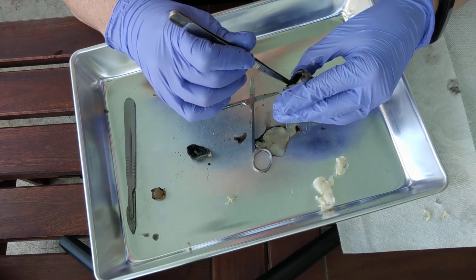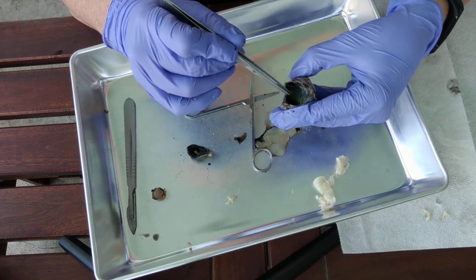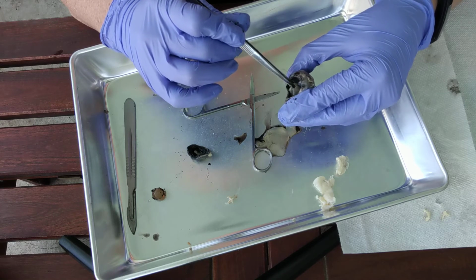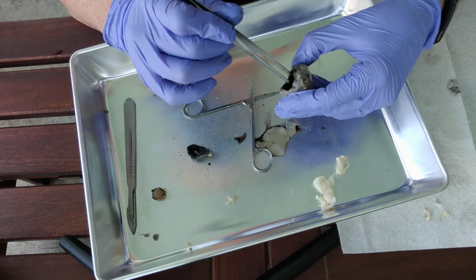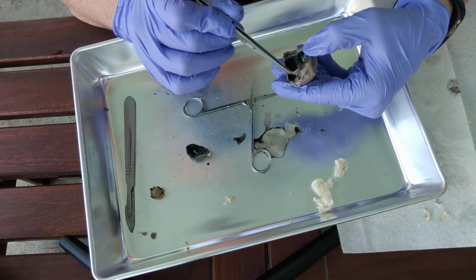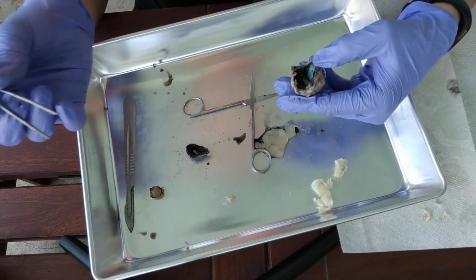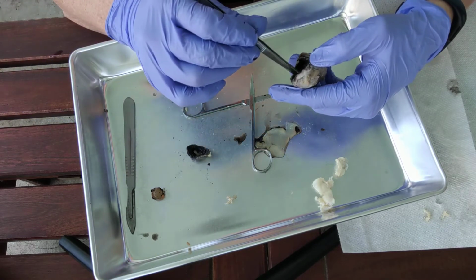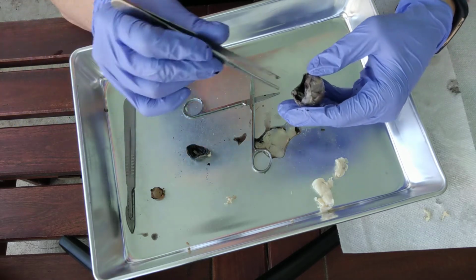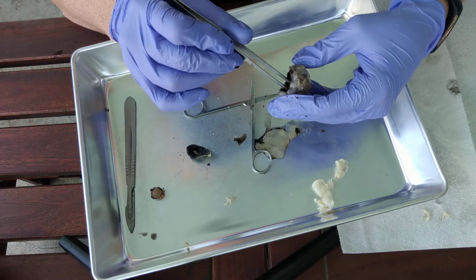Okay, so I'm going to try to gently pull the retina up. See this very, very thin, delicate tan membrane? That is the retina. It's very, very delicate. Isn't it strange? Okay, so I'm going to go ahead and take it out entirely because I want to show you the structure behind it. So we have the retina, which is where the photoreceptors are going to be found, the rods and the cones. And you'll notice that when you try to take it out, it's kind of attached.